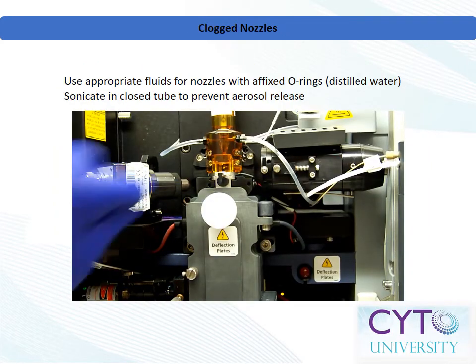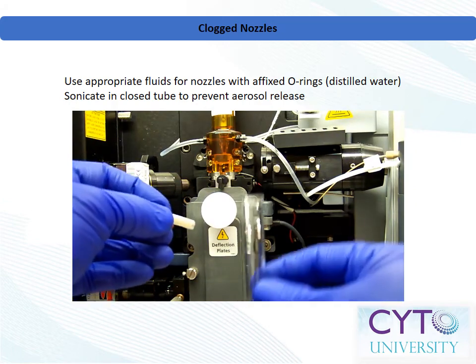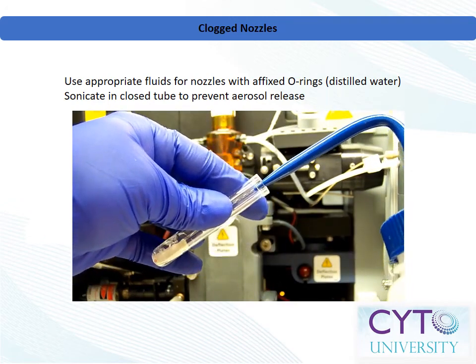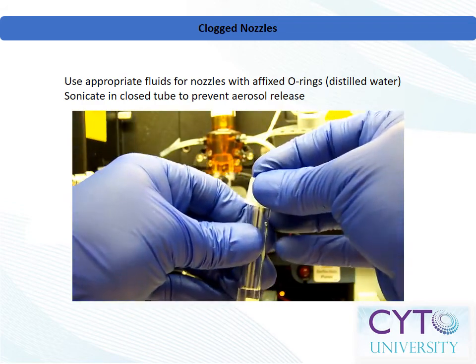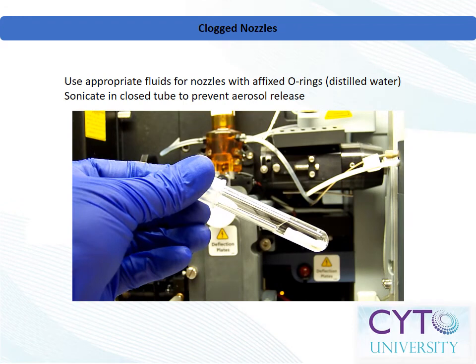In addition to clogs in the sample injection port, cell sorters may also become clogged at the droplet nozzle. For either a stream-in air or flow cell-based sorter, the easiest way to dissolve a nozzle clog is through sonication. Before you begin, be sure to use appropriate standard operating procedure for the containment of aerosols prior to accessing the nozzle or sort chamber of a clogged instrument. Remove the nozzle from the flow cell and place it into an appropriate vessel for its size. Here I'm using a standard 5 ml polystyrene tube for a ceramic nozzle. Fill the tube with purified water until the nozzle is completely submerged.